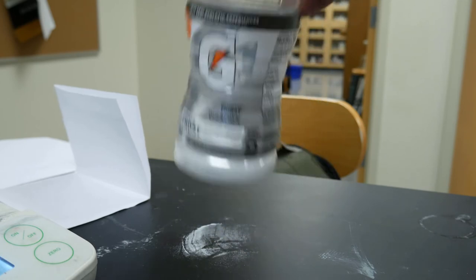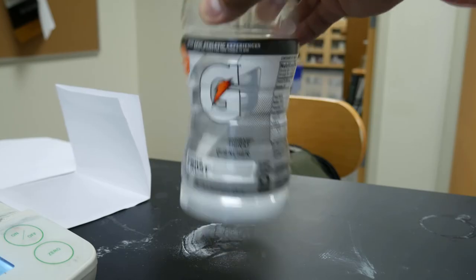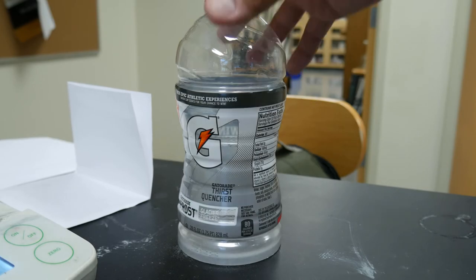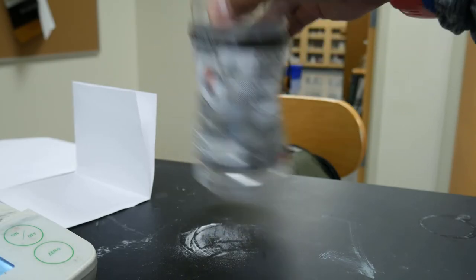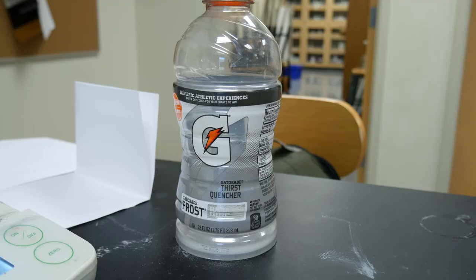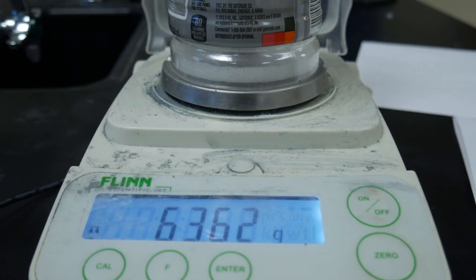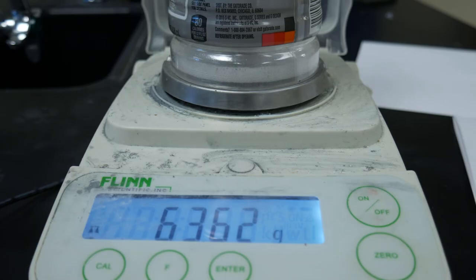Shake this up to make sure the reaction goes to completion, and then we'll weigh it afterwards. Our reaction is complete, so now we're putting it on the scale. The scale says our total mass is 63.62 grams. Please record that on your data table as the total mass of our products for trial number two.